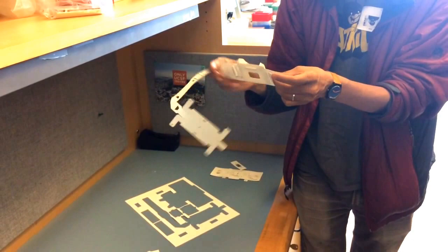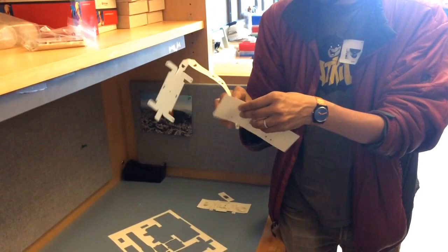Take this out for a second. I'm not gonna beat my own record this time for sure. Oh, it's more than 3 minutes now. That's correct.